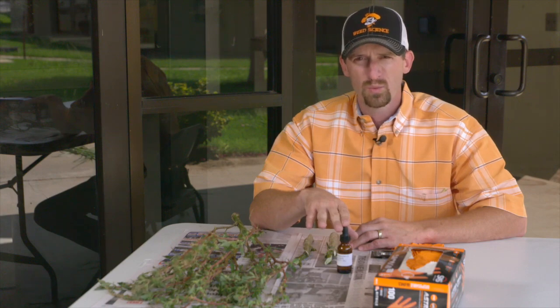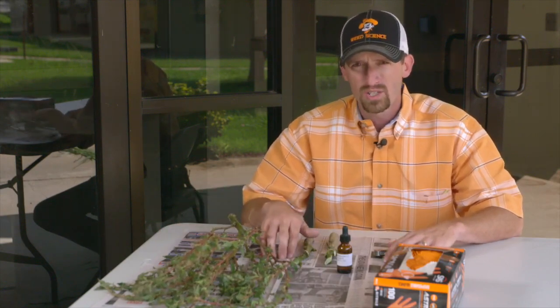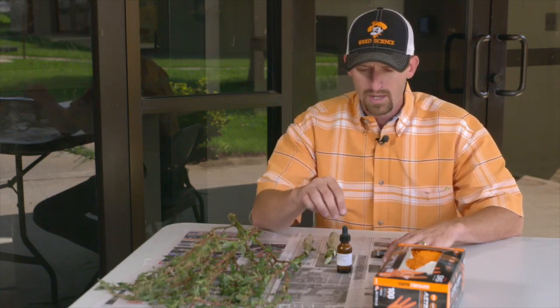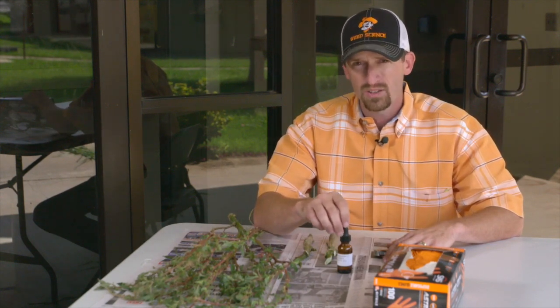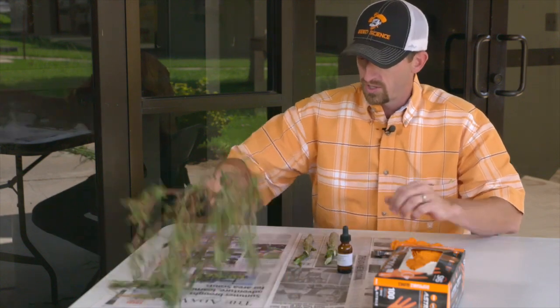I'm Brian Pugh. I'm the Oklahoma State University Area Agronomy Specialist for Eastern Oklahoma. I'm going to talk to you about how to properly test the reagent to make sure it's working accurately. As Dana mentioned, there are proper tools and safety procedures we need to follow. Sometimes we get educators mentioning their reagent is one to two years old, and this is a way you can test to make sure it's still working correctly.